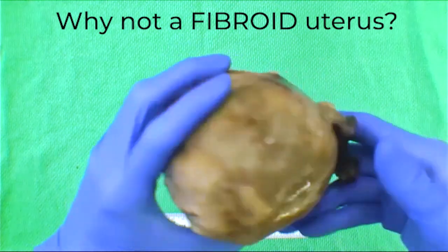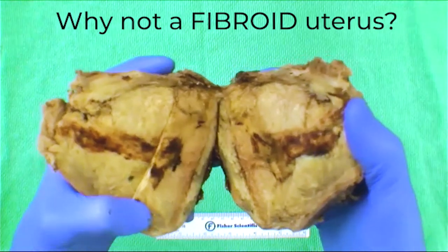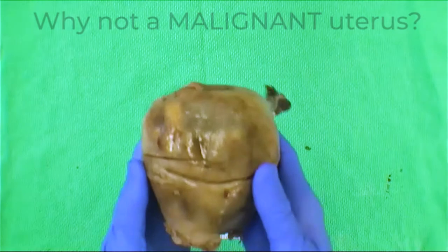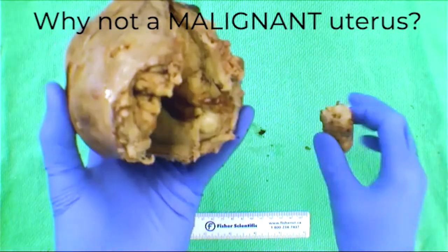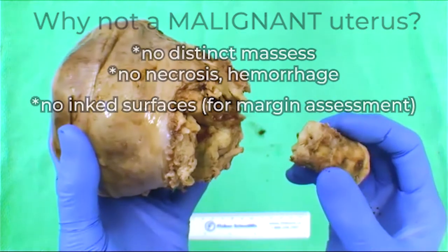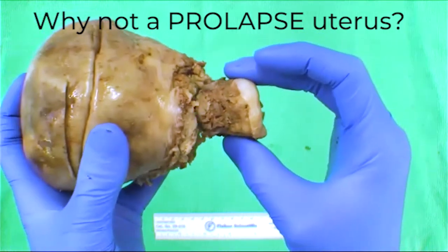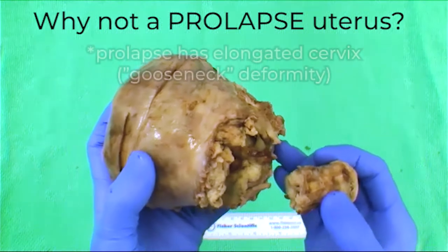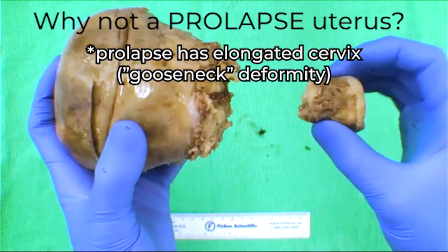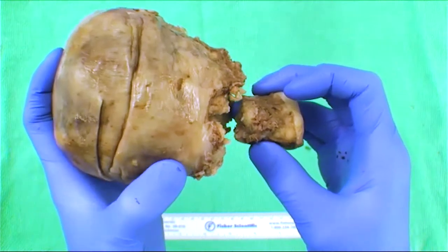Why not a fibroid uterus? It's more symmetrical, and it's not like one discrete mass. Why not a malignant uterus? Practically speaking, there's no ink on it — that's a giveaway. And why not a prolapsed uterus? The cervix is not elongated — there's no gooseneck deformity, which is the classic distortion of the cervix seen in prolapse, typically in an atrophic uterus in an elderly patient.